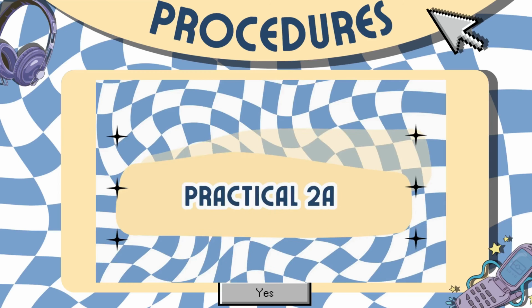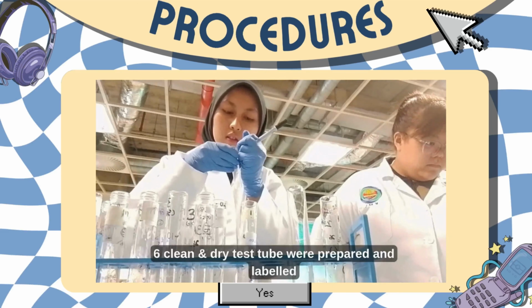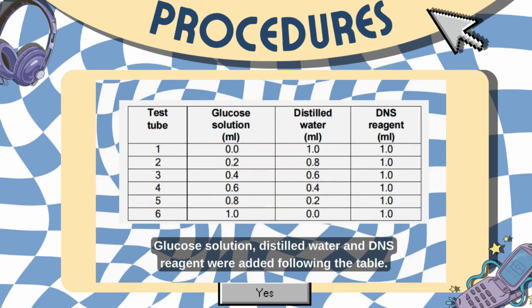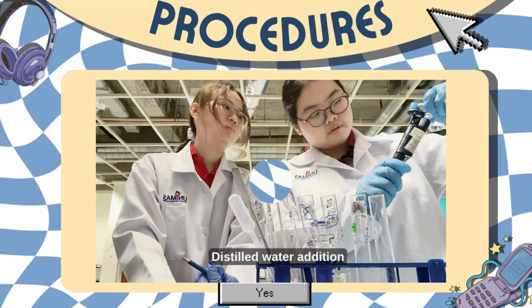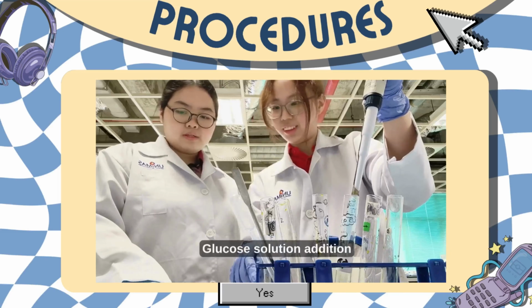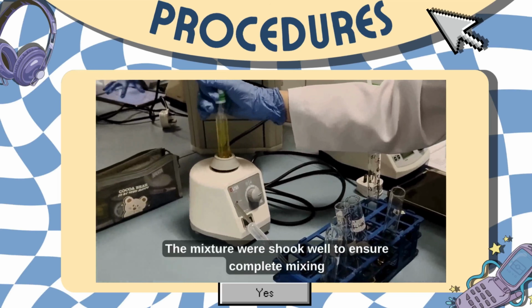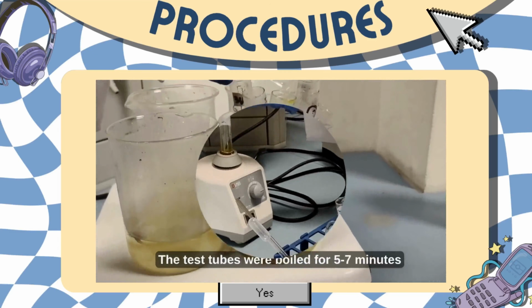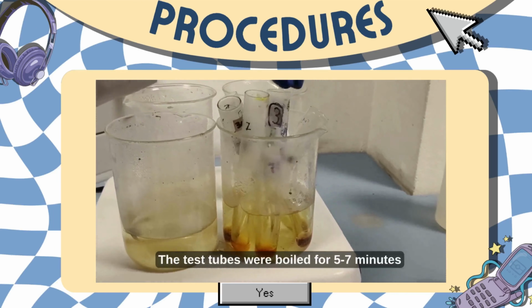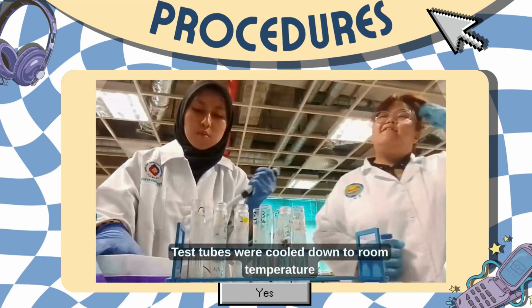For practical 2A, 6 clean and dry test tubes were prepared and labeled. The glucose solution, distilled water, and DNS reagent were added into the test tubes following the table. Distilled water addition, DNS reagent addition, glucose solution addition. The mixture is then shook well to ensure the complete mixing. The test tubes were boiled for 5 to 7 minutes. Then, the test tubes were cooled down to room temperature.